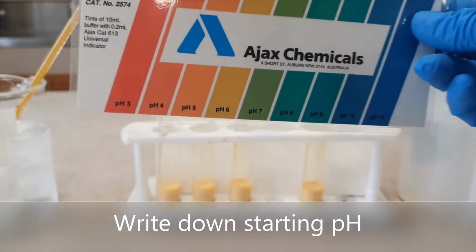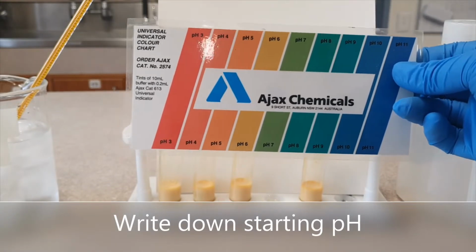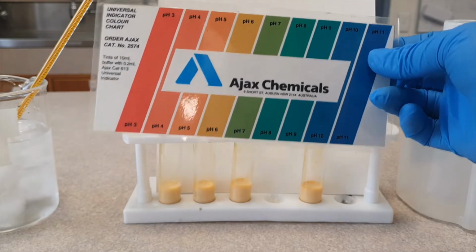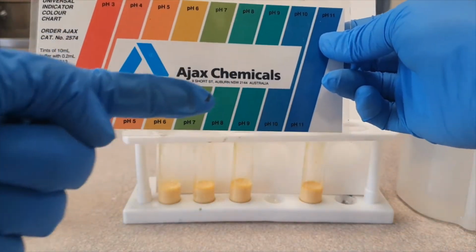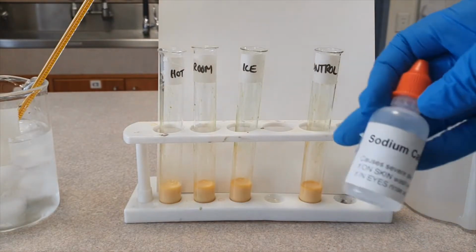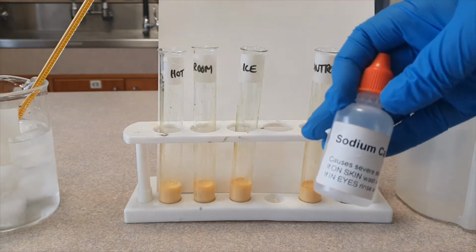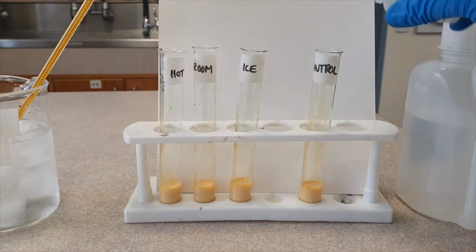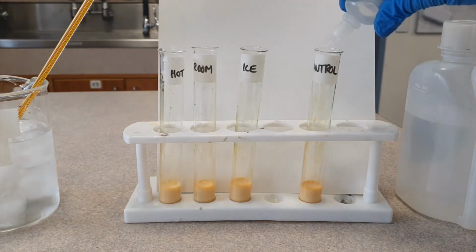Okay, so you can decide. I won't give you the answer. Whatever pH that's at, we're going to push it more this way by adding some sodium carbonate. So I'm going to do that now. The next step is to add 3 drops of sodium carbonate to each tube. 1, 2, 3.